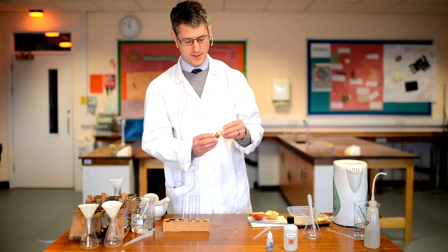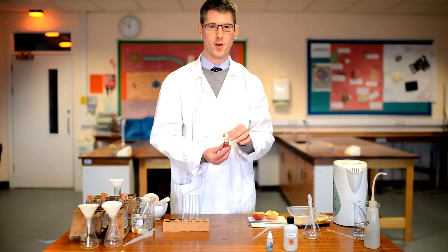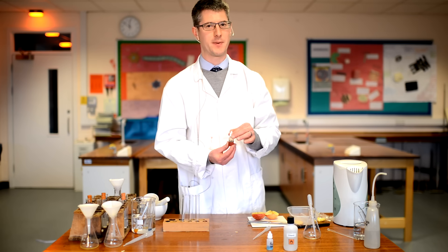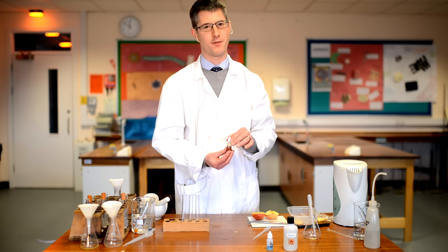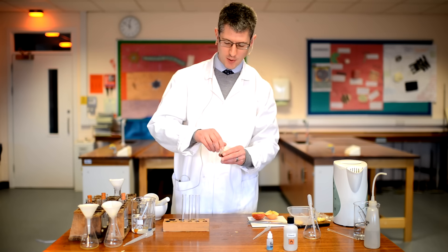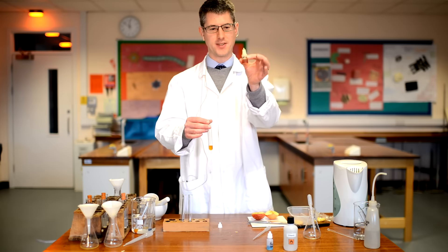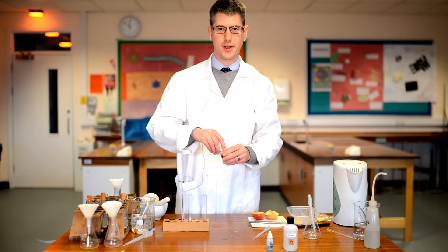The second test for a carbohydrate is a test for starch — this is a large polymer of glucose found in plants. The test for this is the iodine test, which is one that can come up particularly in questions about photosynthesis. The product of photosynthesis is glucose; plants then store excess glucose as starch, so a presence of starch is a sign that photosynthesis has occurred. In this case we're looking for starch in the food sample. All we have to do is add some iodine — the iodine is initially an orange colour — and we'll see what colour change we get at the end.